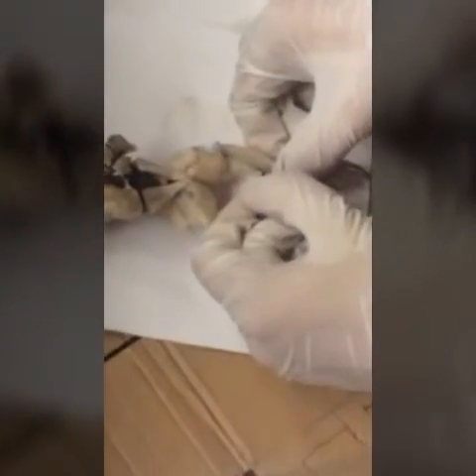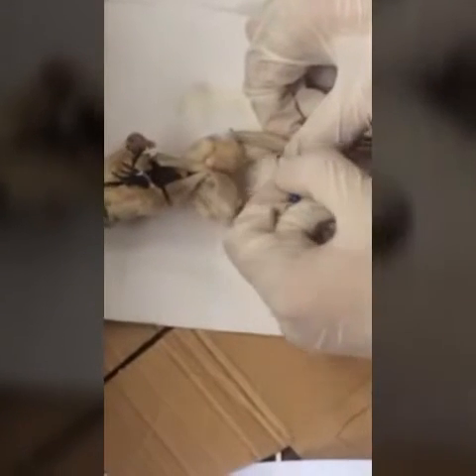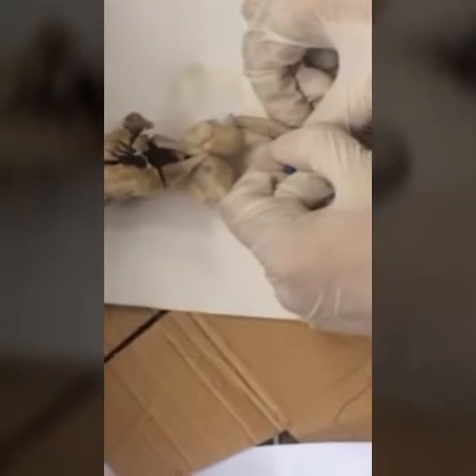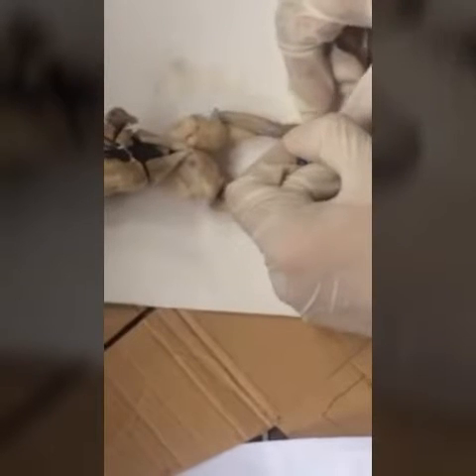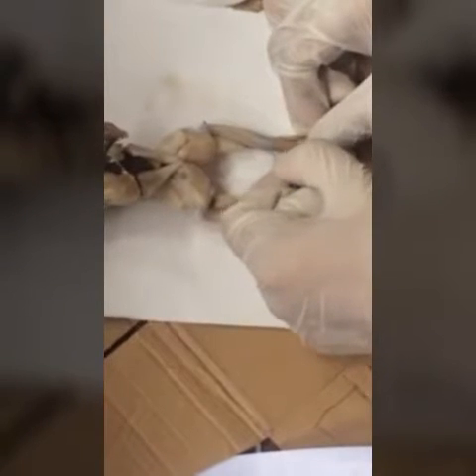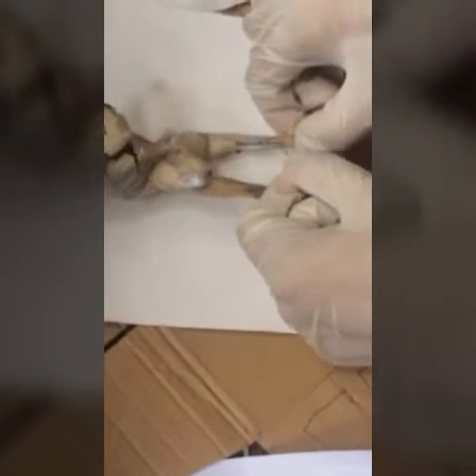We have the gracilis major again right over here, or the rectus internus. And we have the extensor cruris over here. We have the tibialis anticus over here. Flexor tarsi anterior over here. Tibialis posticus over here. And the tendon of Achilles right over here.